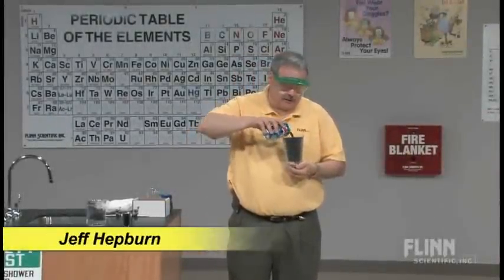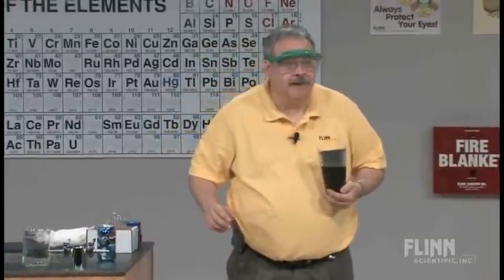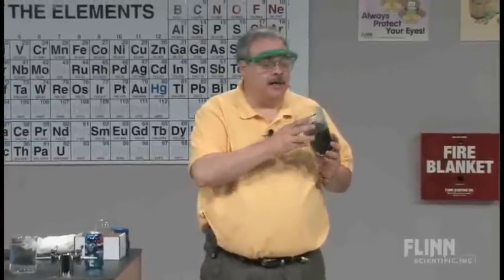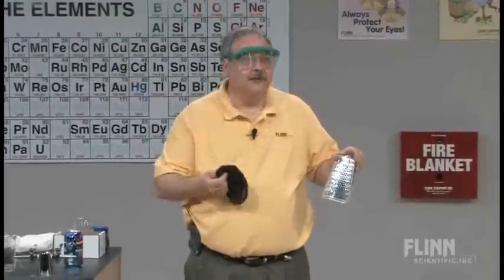I don't know about you, but under these hot lights, I get kind of thirsty. So, what? What's that you say? We have to practice safe chemistry? We can't drink in a lab? Oh, thanks for telling me. I am so relieved at that. Boy, I could have had some real trouble there for a minute if you wouldn't have told me that.